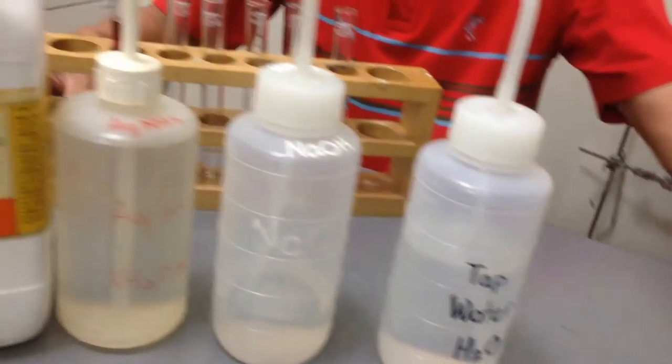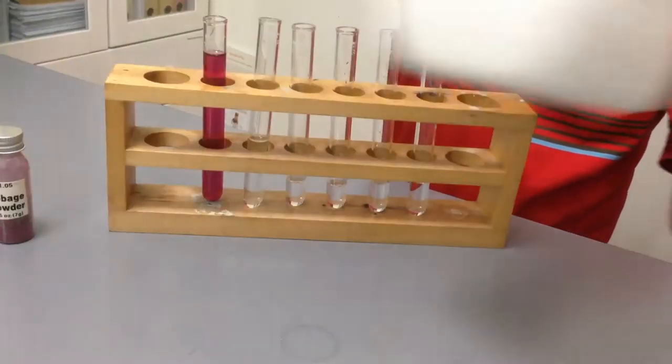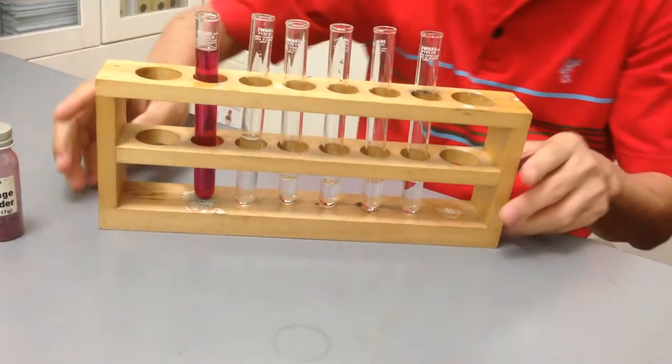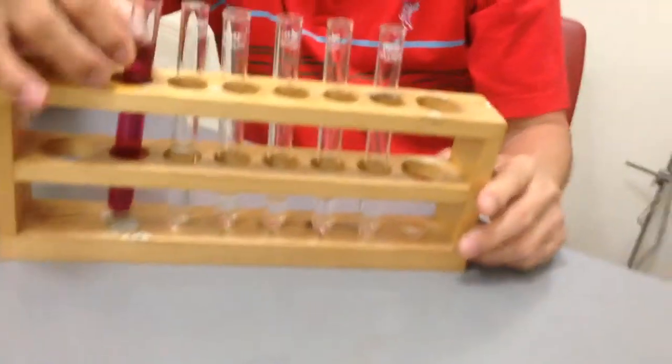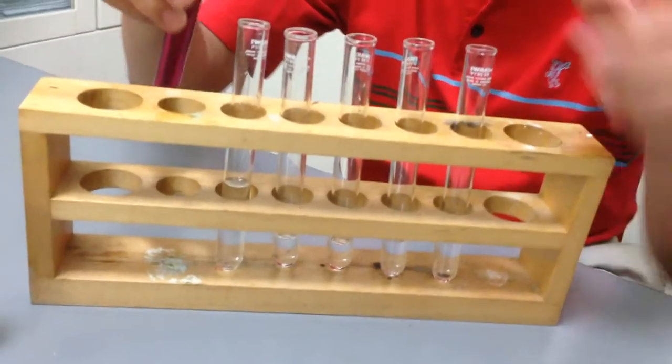So we have got five test tubes. And we are going to add red cabbage solution into these five test tubes.